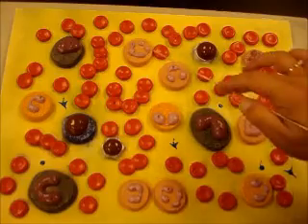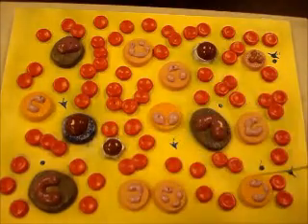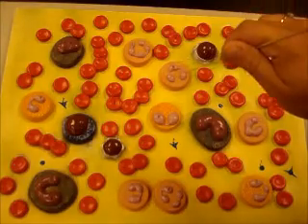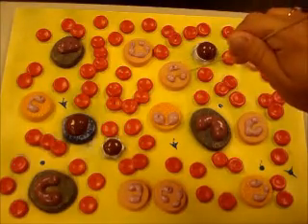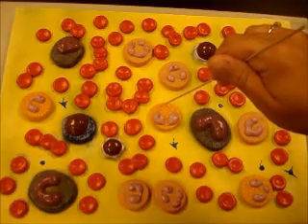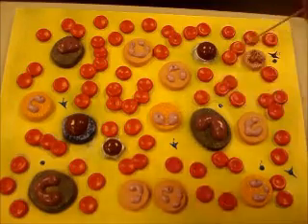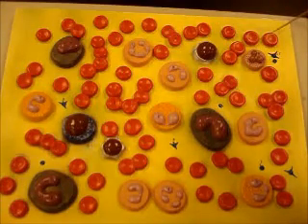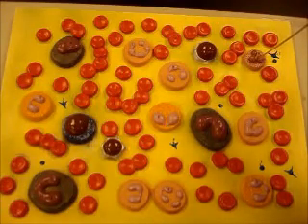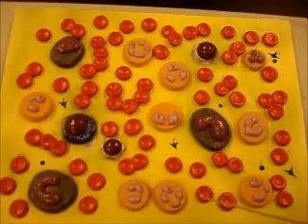So those are your three granulocytes: neutrophils, eosinophils, and basophils. Neutrophils have neutral pale cytoplasm and a multi-lobed nucleus. Eosinophils have red staining granules and a bilobed nucleus. Basophils show lots of dark purple dots and a two-to-three lobed nucleus. They are all about the same size, though the basophil is the smallest of the three.